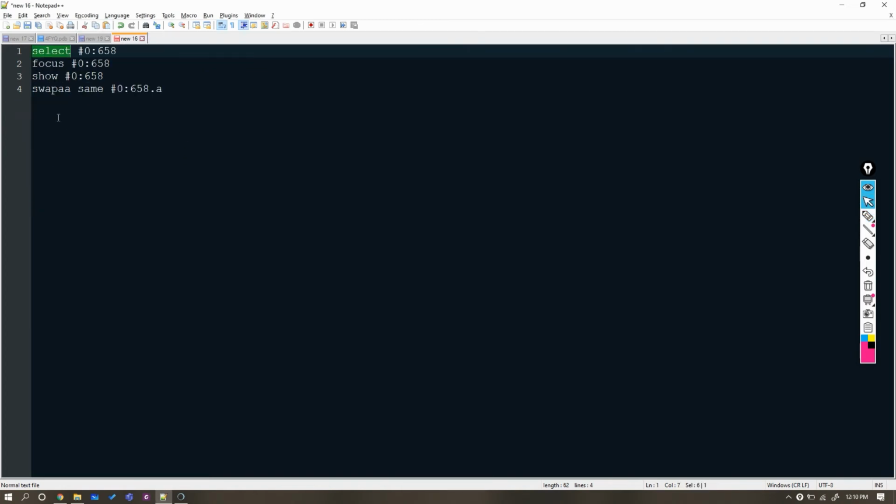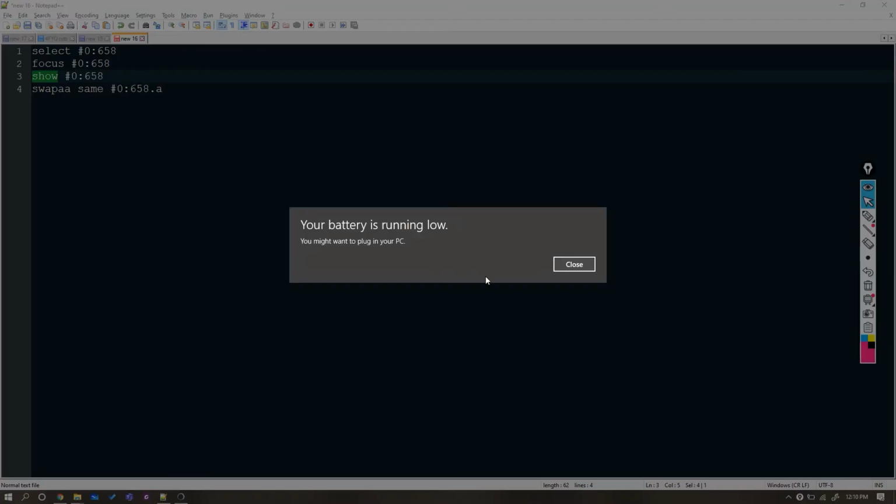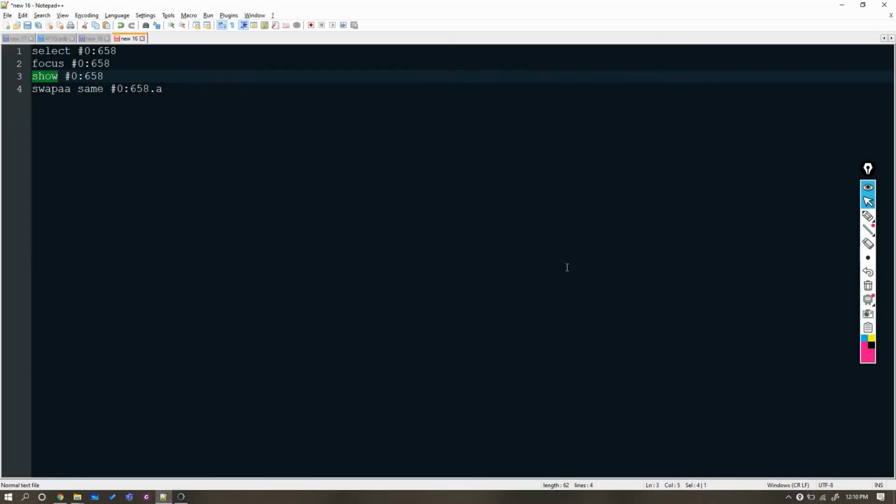Here I have written some of the commands which are required to do the same thing. First we will select a specific residue, then we will focus it in the window. The show command will show the sticks for it. Okay, I'm back. And the swapaa command with the same option will select the best rotamer for the same residue automatically.